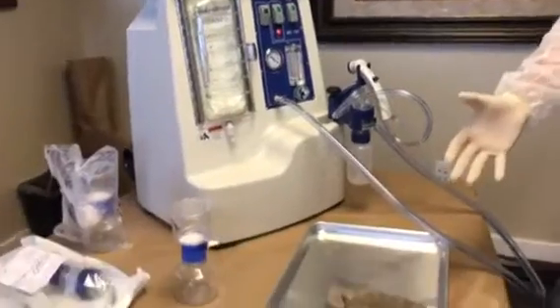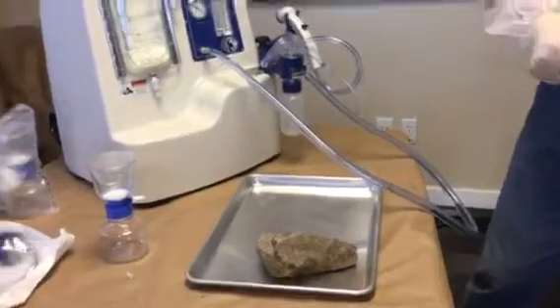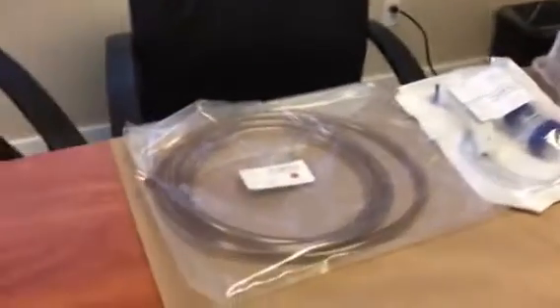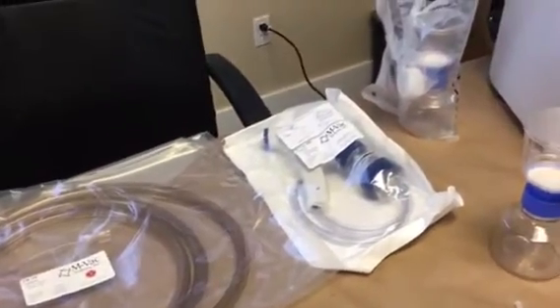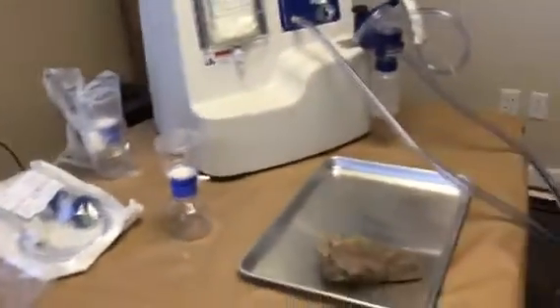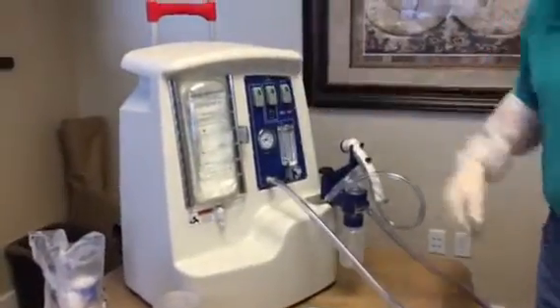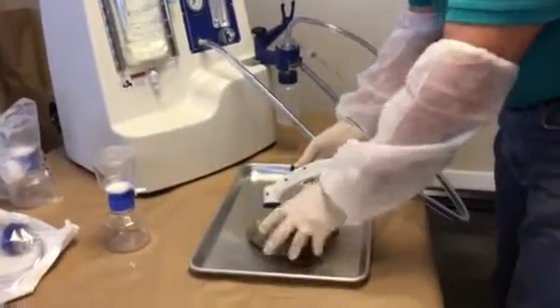What we're actually going to sample today is a rock taken out of the Provo River. It's very similar to the rock that was used to kill Krystal Bizlonowich back in 1996. Now that the solution is pressurized, we can turn this on and we're ready to rock — literally.